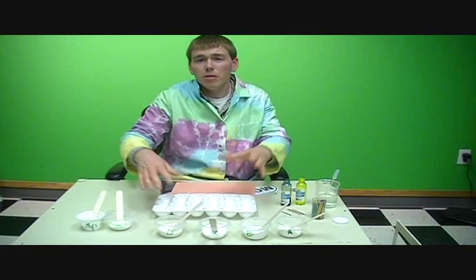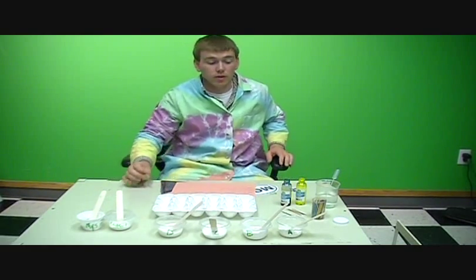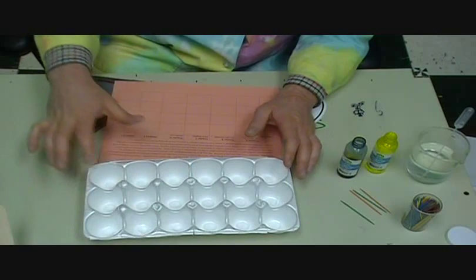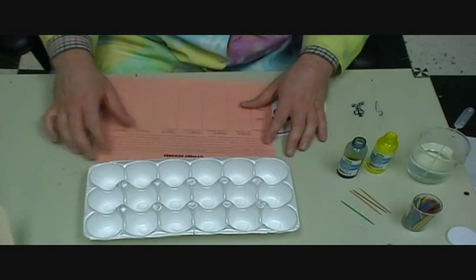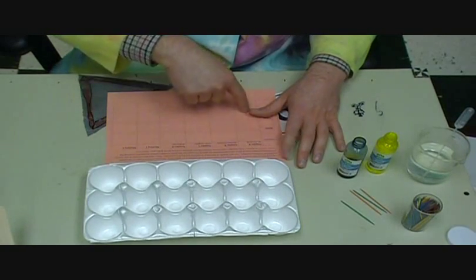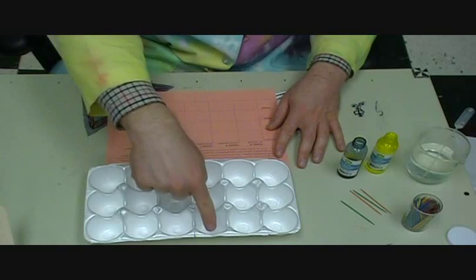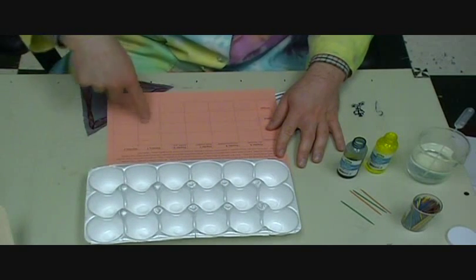Okay, so I'm going to change the camera angle and just show you the setup here, what students are going to have to work with. Each student or group of students is going to have an 18-egg styrofoam egg carton, and that's going to work out just perfectly for the number of powders we have to test. And what I like students to do is line up their egg cartons with these columns on their worksheet. So this would be column A, Mr. Mansfield, column B, Grandma, column C, Susie, column D, Dudley, and then that leaves 2 for mystery powder 1 and mystery powder 2.